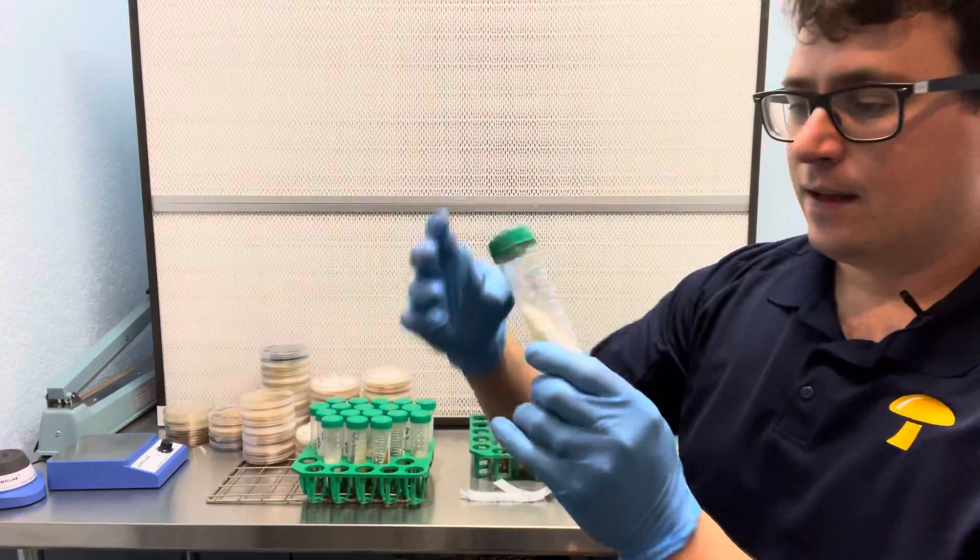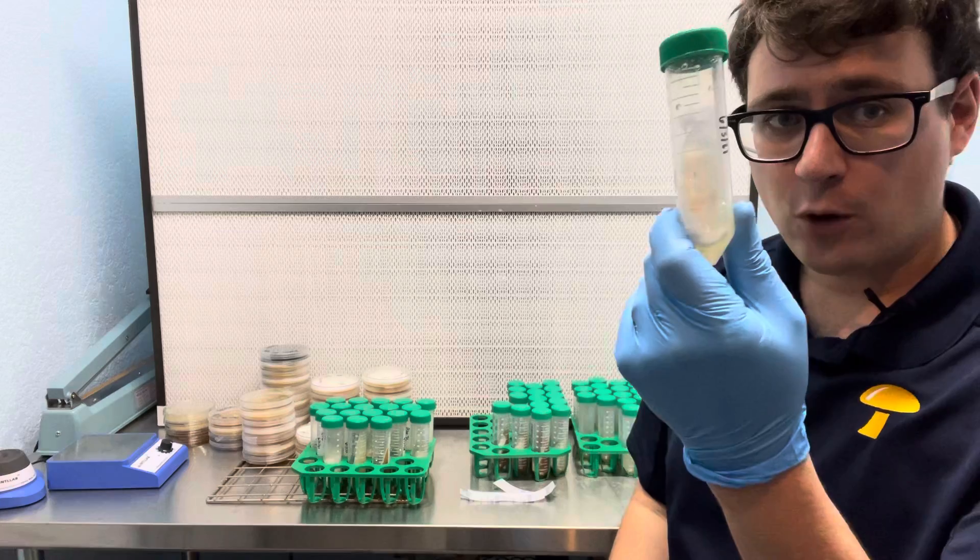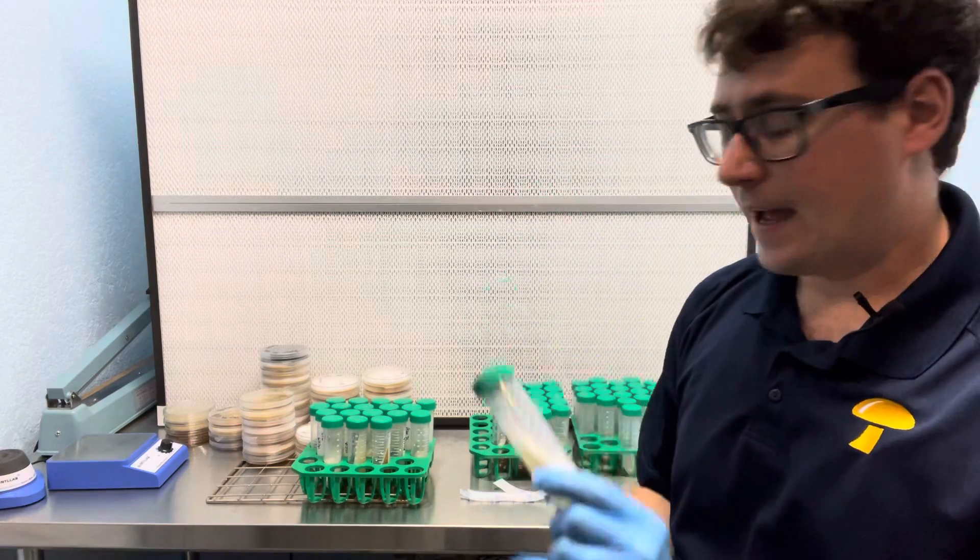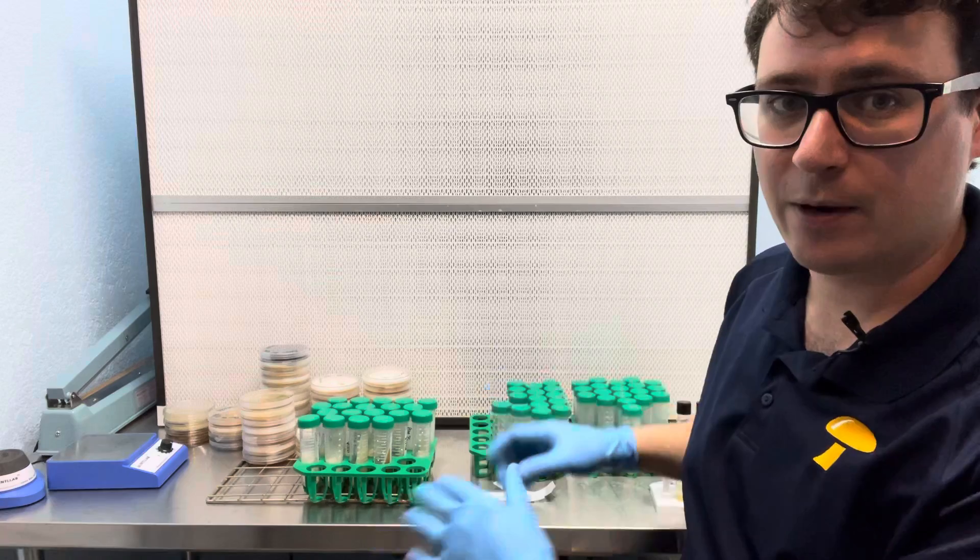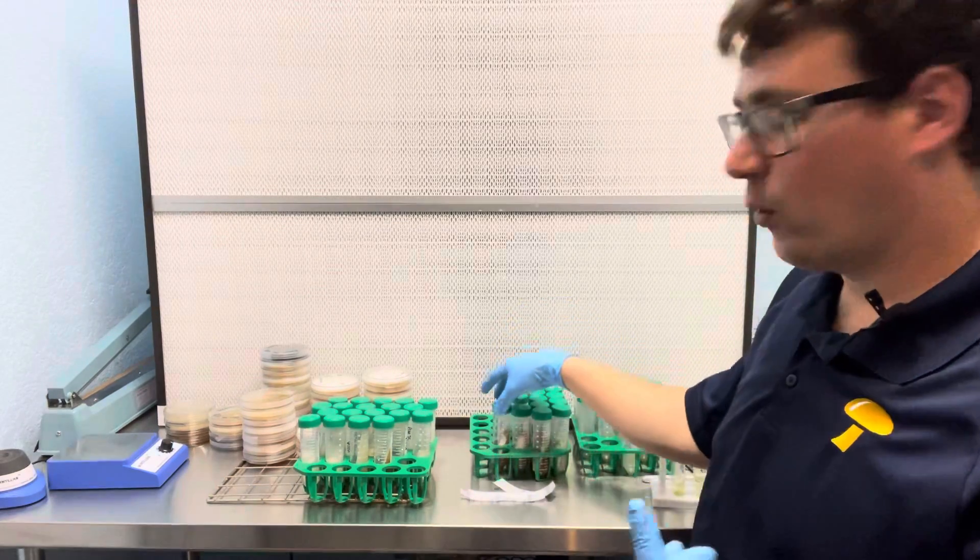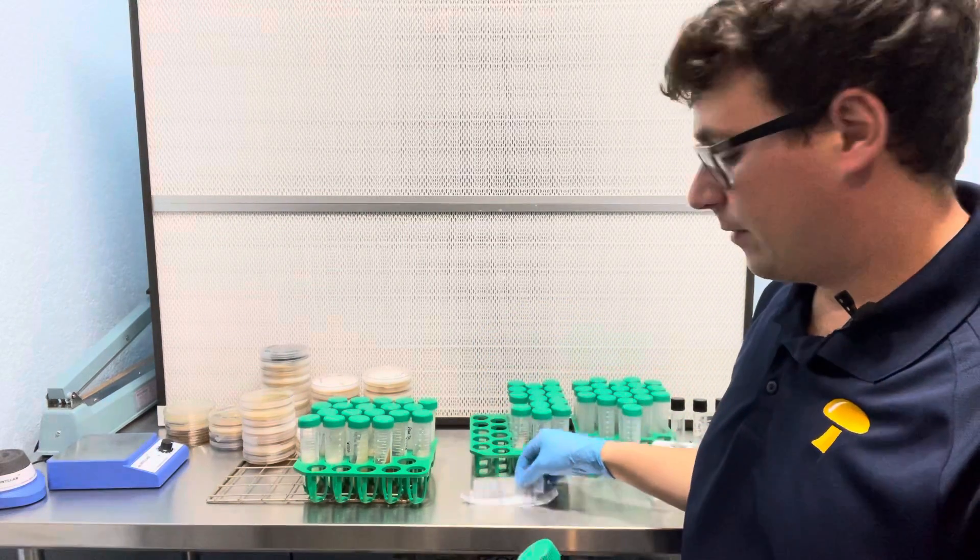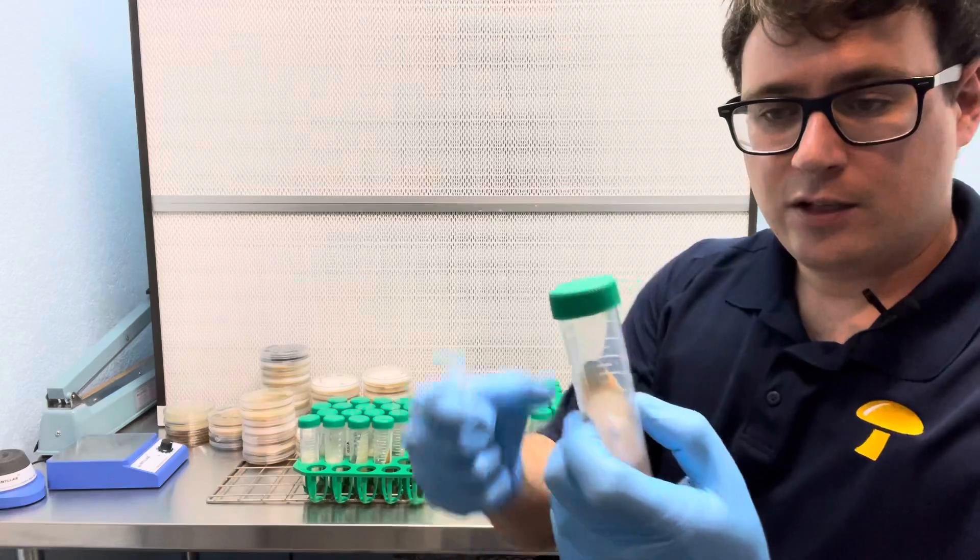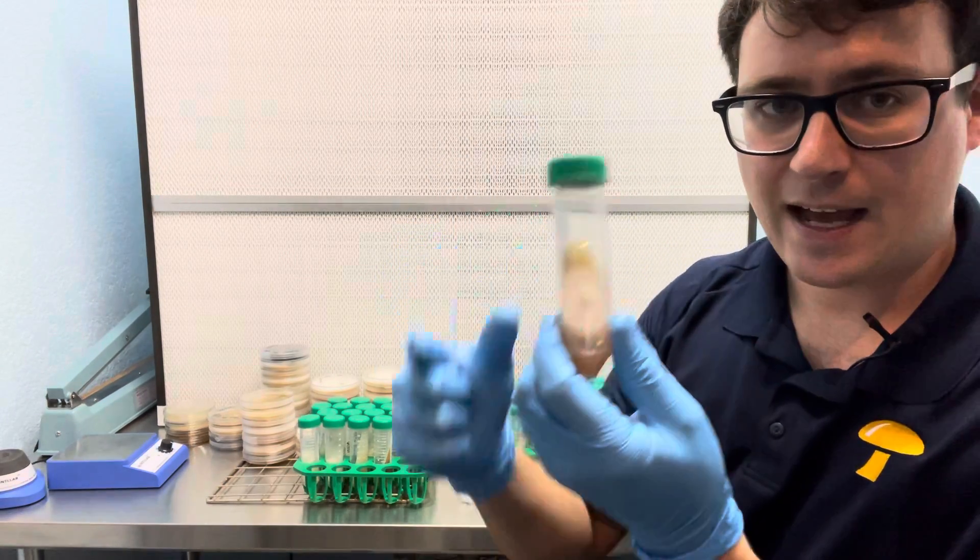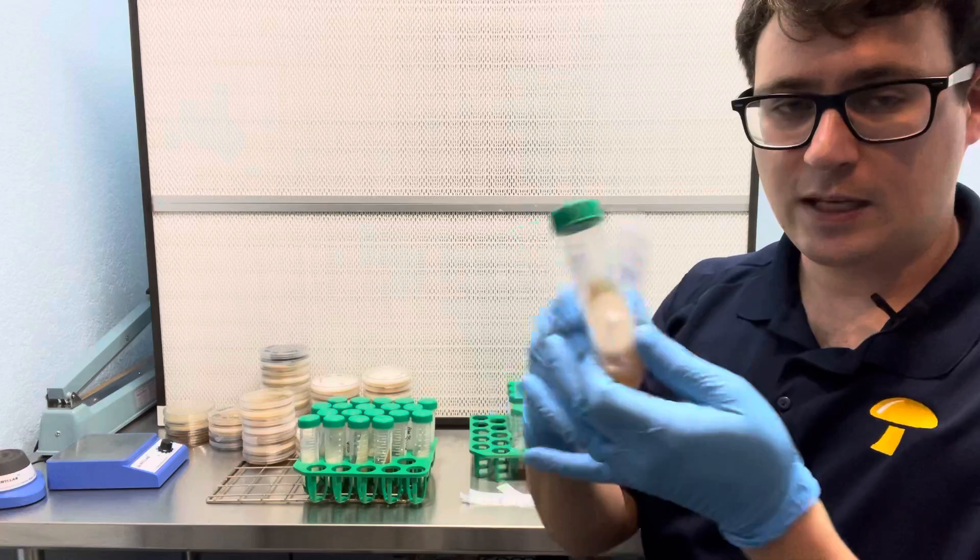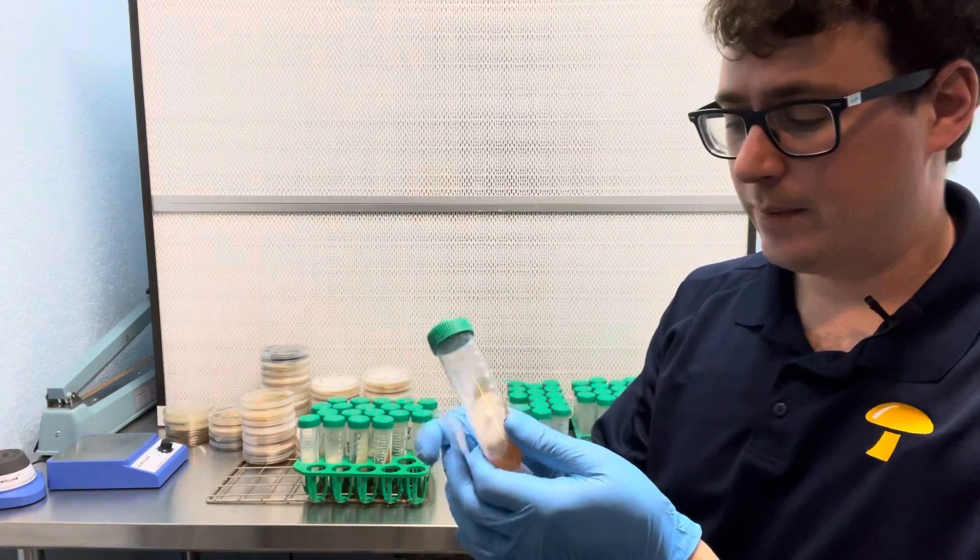So I'll just be pulling these out for our spring production and I have about 30 more phenotypes that I'm going to be adding to my library but before I put them in you can just really screw them tight. There is enough air inside this chamber in vitro to keep the mushroom going when it's in a cooler environment.